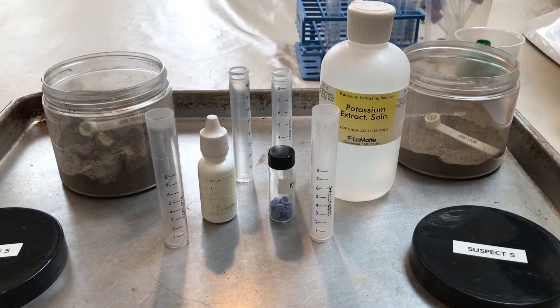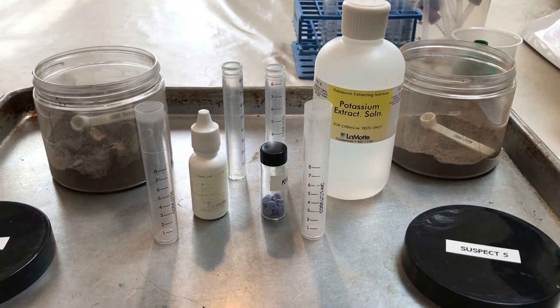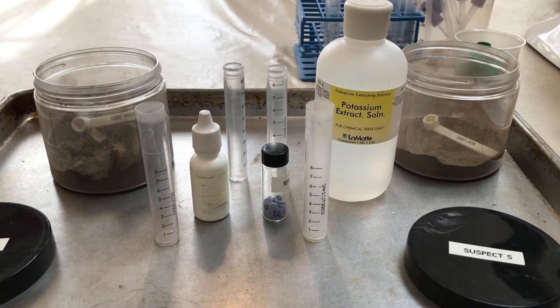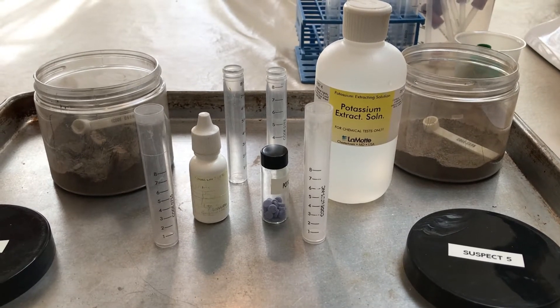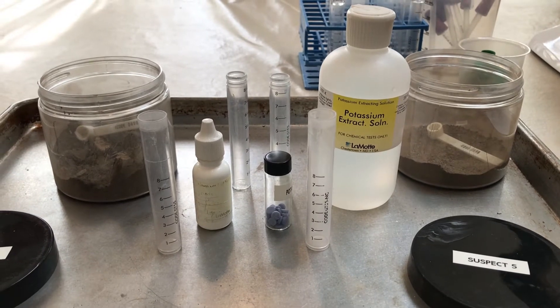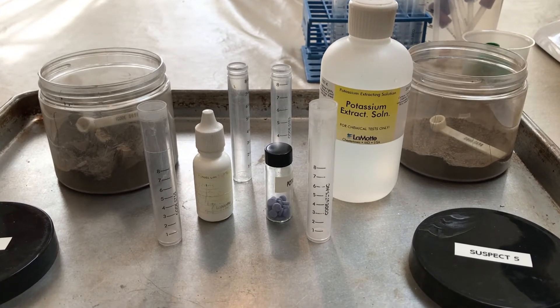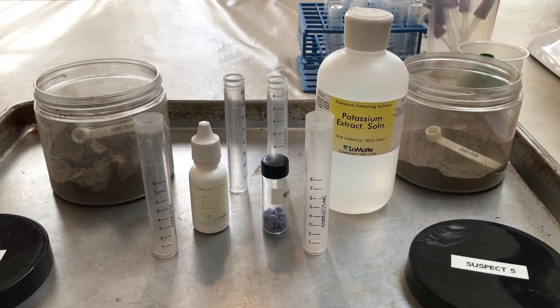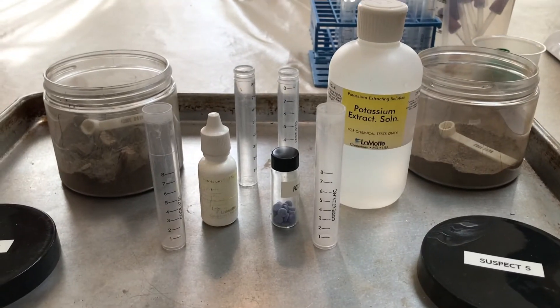All right ladies and gentlemen, now we're going to do our potassium test on our two soil samples. This is very similar to the phosphorus test except one key difference. After the pipetting step and adding the potassium test tablet, we actually determine the level of potassium by the number of drops of potassium indicator that we add to the solution until the color changes. So the fewer the drops we need to add, the higher the potassium level. We're going to get started on this and we'll pick it up when we get to the indicator solution part.